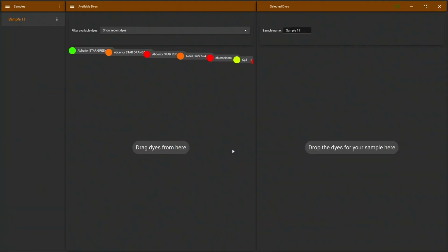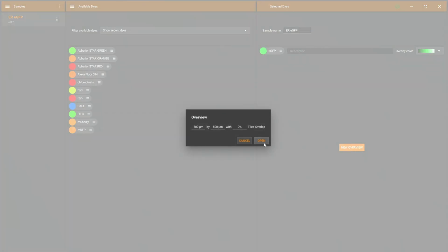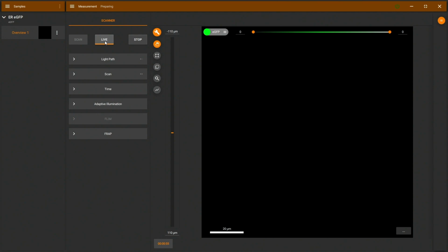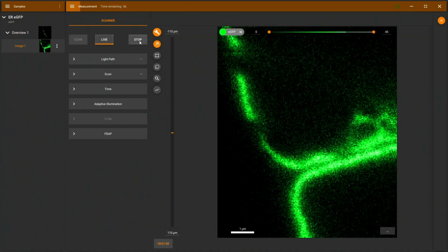Okay, I believe there's one last thing left to show, and that's the combination of matrix detection and STED. Since I promised this at the start of the presentation, let's try to do this in the sample. I'm going to switch to the software. Here we create a new sample, eGFP, name this ER GFP, new overview, and in live mode we will see the ER, but this time we are quite a bit above the leaf, and we're looking at one of these outgrowths. Here the ER is very dense, and we will see the benefit of matrix detection.